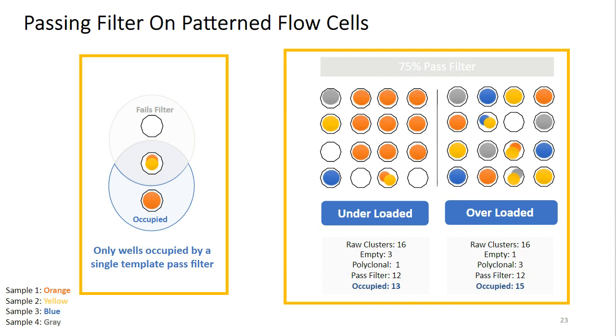This results in the majority of the occupied wells passing filter, though we can see that a single template has several duplicates. Now in the overloading condition, we can see that we have fewer duplicates and fewer empty wells, but we do have several polyclonal wells which will not pass filter. Overall, both conditions show the same percent clusters passing filter of 75%.